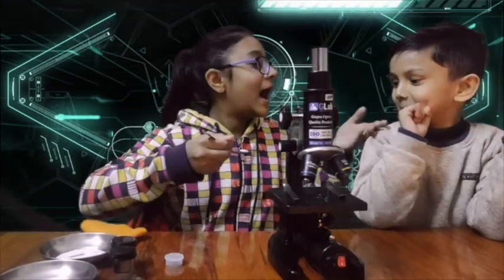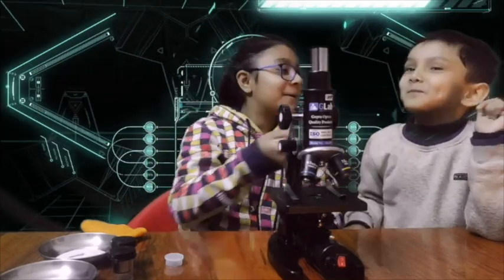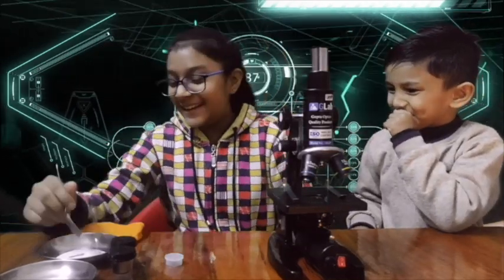We are going to first test what this thing is. I am really nervous about this. Ah! Salt! Okay. That is salt. I got one item. Yes.